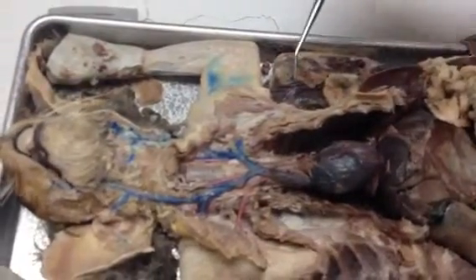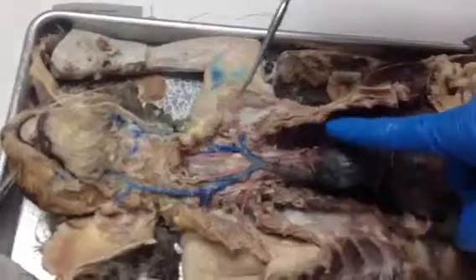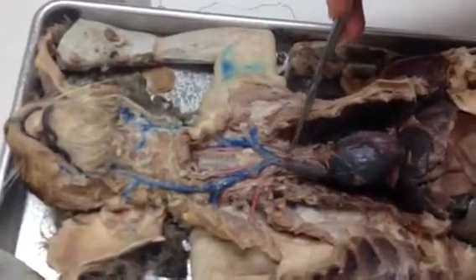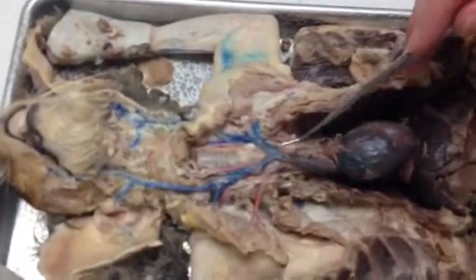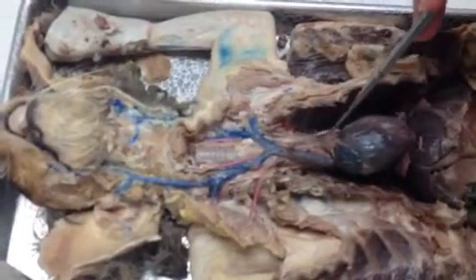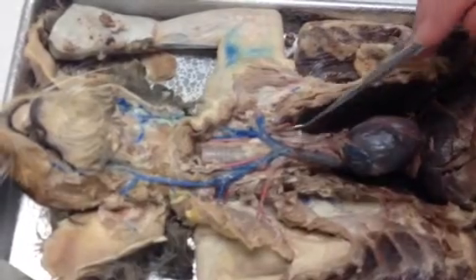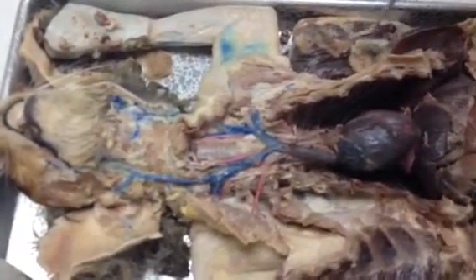Okay? All right. Now, what other arteries do you need to know? The left subclavian comes off the other side of the aortic arch. And right here's the left subclavian. We can't see that in this cat at all. So there's the left subclavian, but it's going to come down off of the aortic arch directly, which we're not going to see in this cat at all. That's it for the arteries.